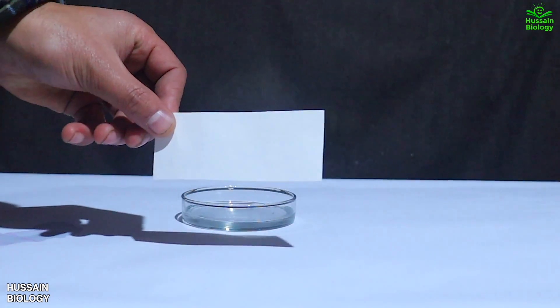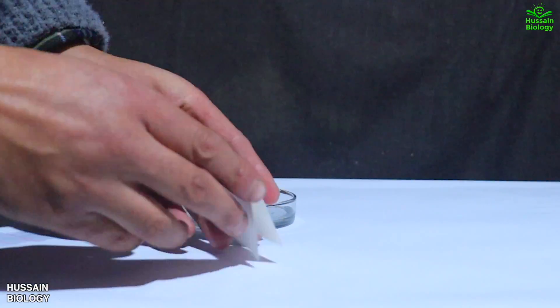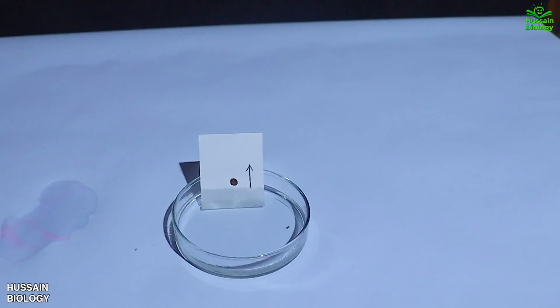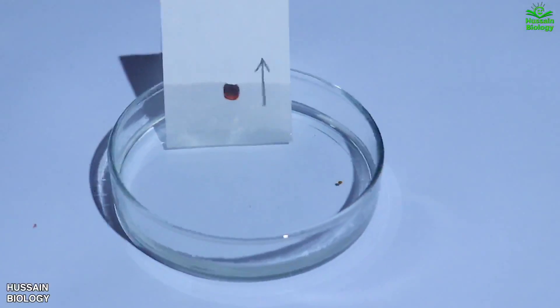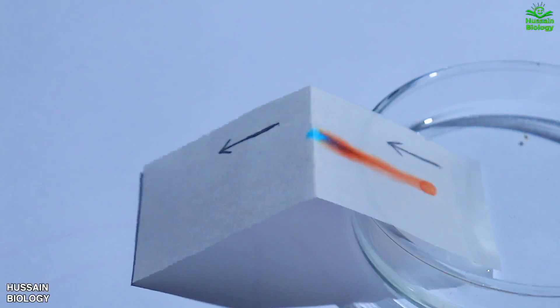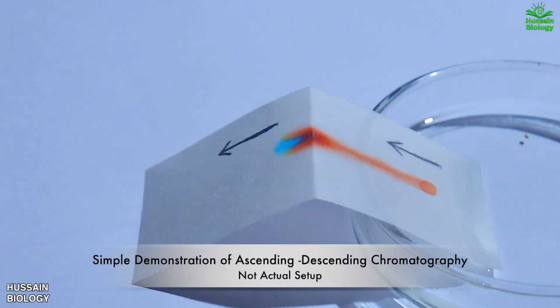To illustrate this, we take a petri dish with solvent in it and a piece of filter paper folded as shown in the video. We drop an ink spot on it and put the filter paper in the petri dish so that we get an uphill and downhill structure. The solvent starts moving upwards taking the ink mixture with it, reaches the top, and then starts moving downward — giving us the ascending-descending chromatography.